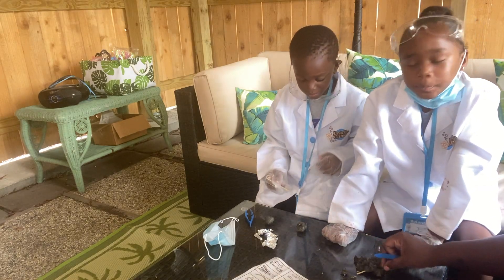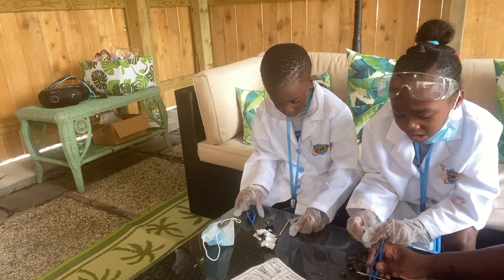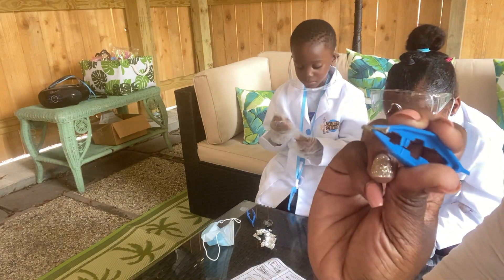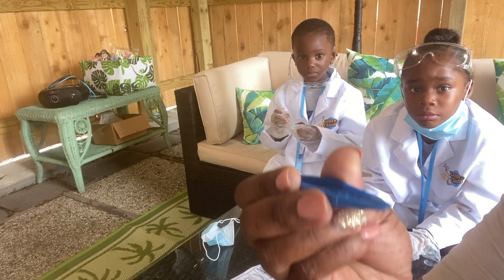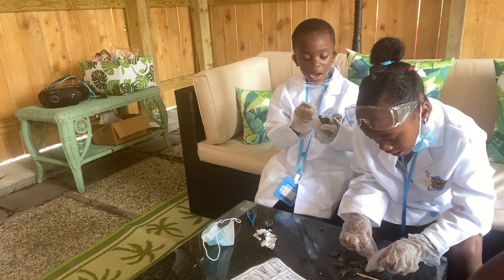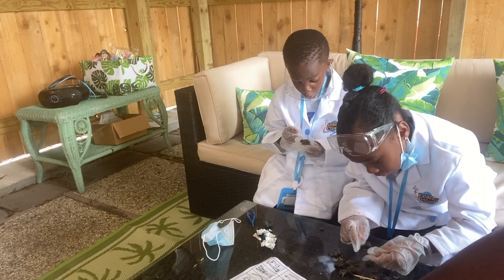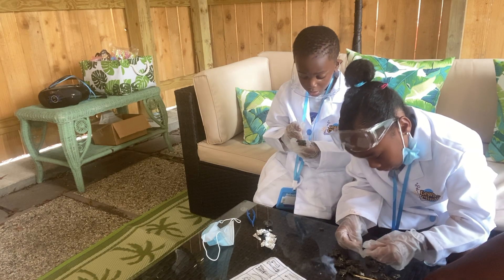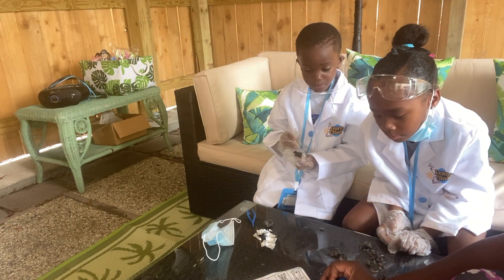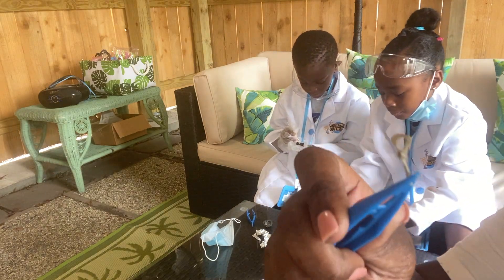Let's see what you have, Carmela. Come on, you got some more stuff in there. Let's go, scientists. Break it up, let's see the bones. Look at the bones — these are some more bones from the mouse. This is a bone. Y'all see that bone? Look how little. I got a bone from a rat. Which animal do you have, Carmela? I don't know. That right there — that's his pelvic bone. Look at a little mouse's pelvic bone.